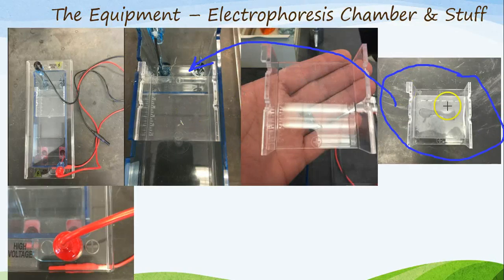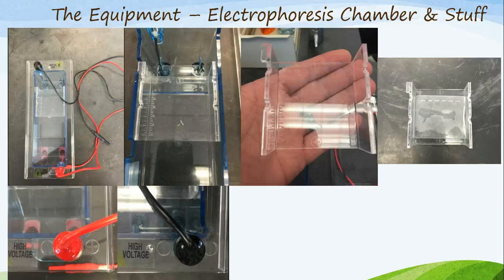Therefore, let's put that tray inside this notch here. If you have it the opposite direction, it will not fit. So this notch ensures that you have the tray in the exact spot in which it is required. You will also notice by careful inspection that the electrodes themselves have an indicator on them indicating the charge. Red is positive and the black is going to be negative.